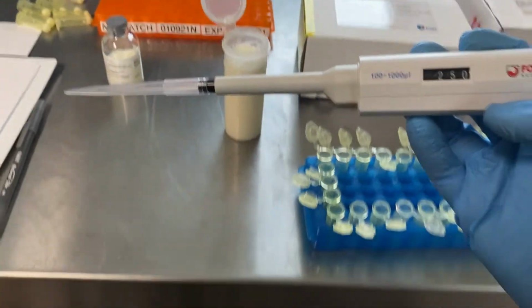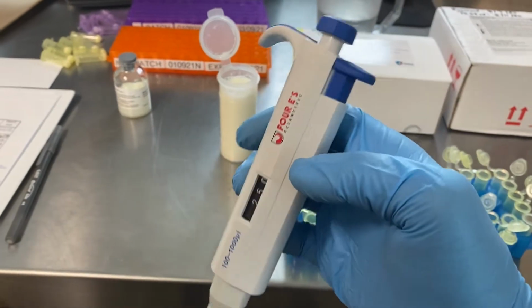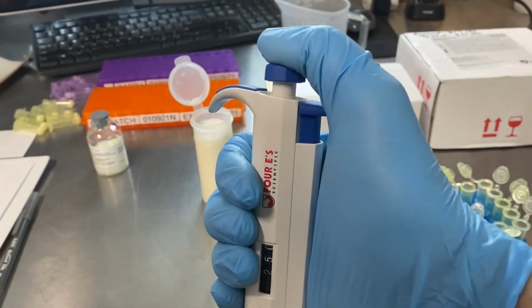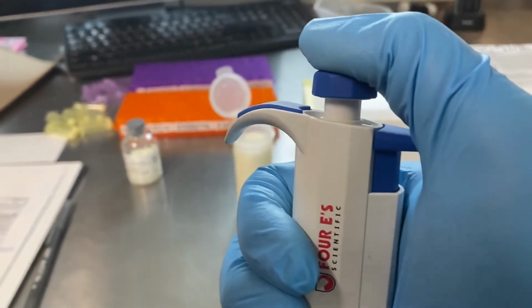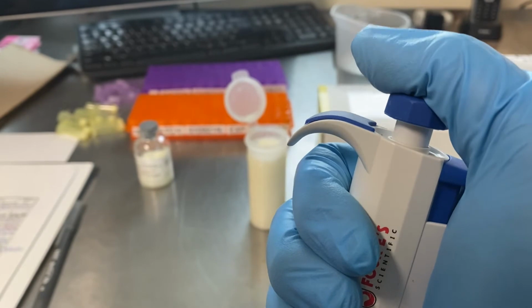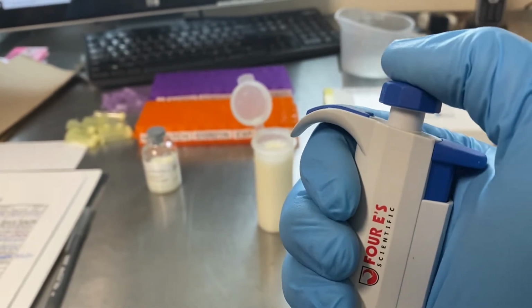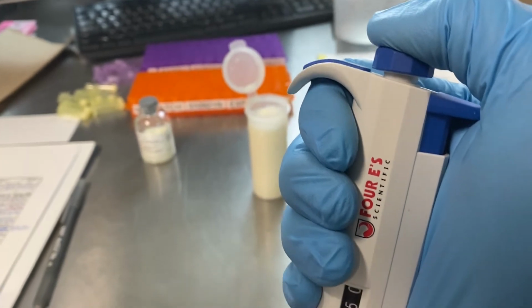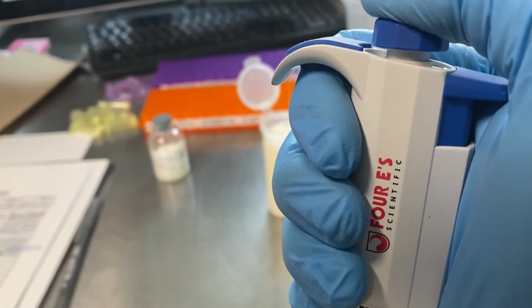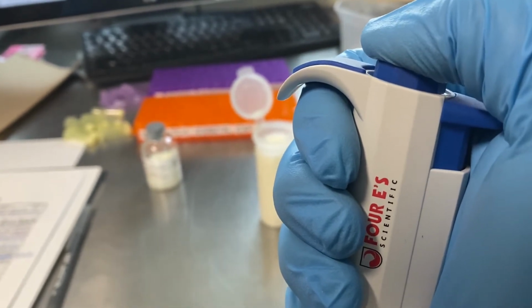The way this pipetter is used is it's a two-stage plunger. The first stage is we press down halfway and it sort of stops right there. The first time you click it for the day, it's a little hard. So let's try again. All right, so you depress it halfway and it stops. You can see there's sort of a stop. It hasn't gone down all the way. And then there's a second stage, we press down again, and that presses it the rest of the way.